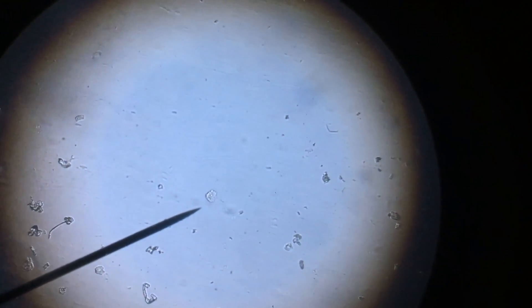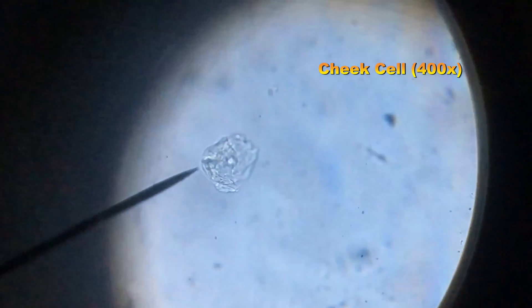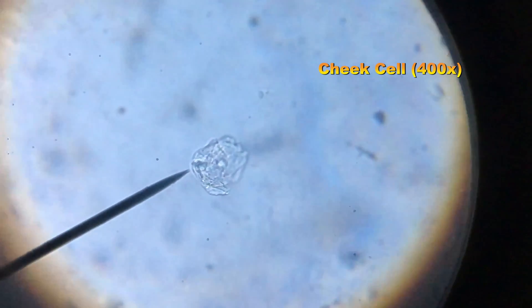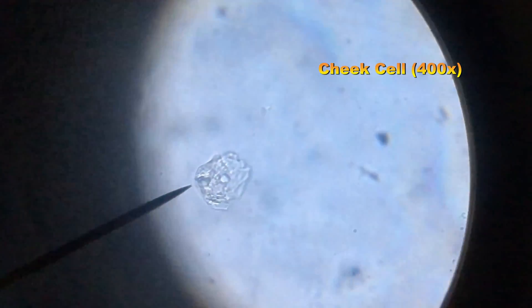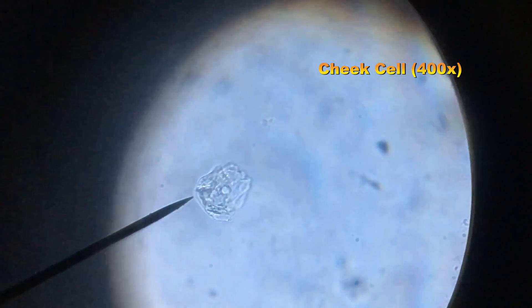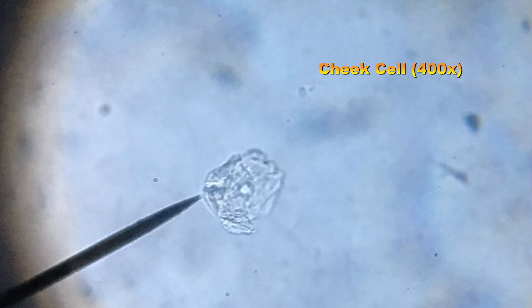My video for low power didn't turn out, so we'll skip straight to high power. This is the cheek cell under high power magnification. And here's the still photo.